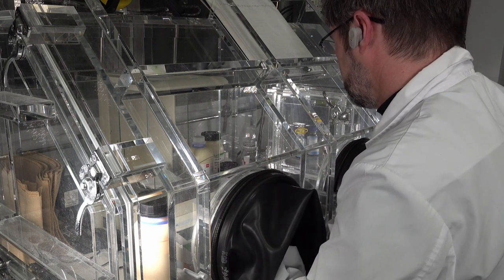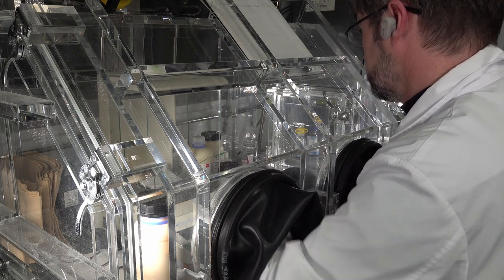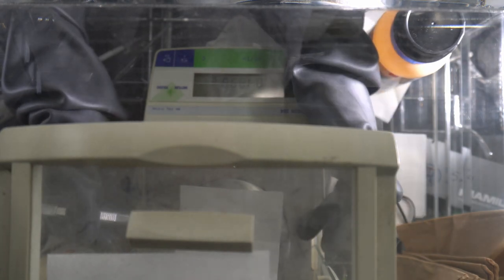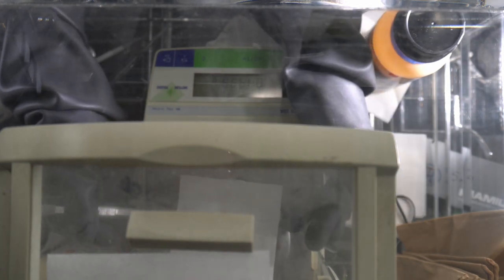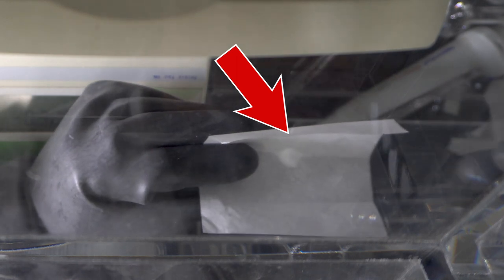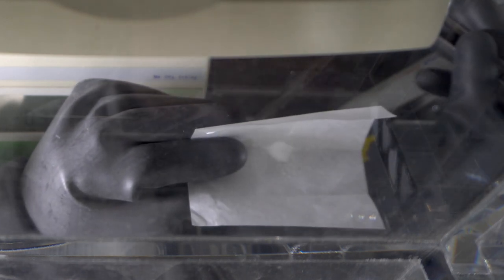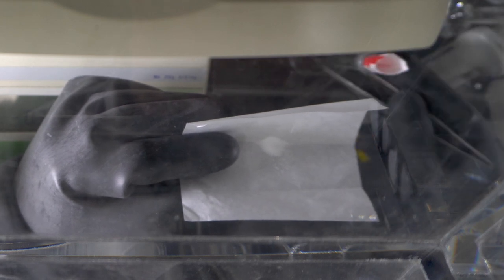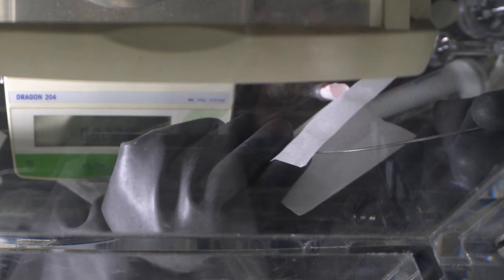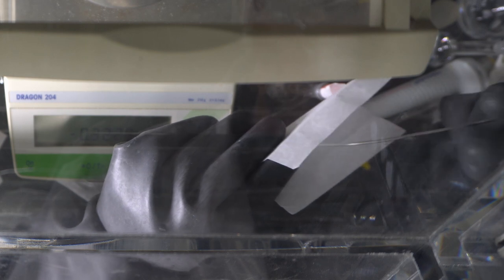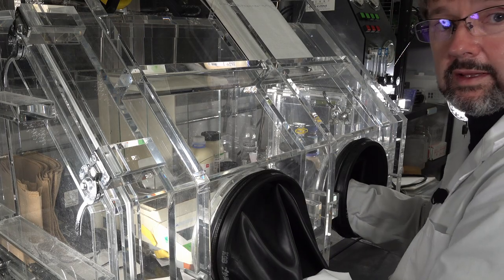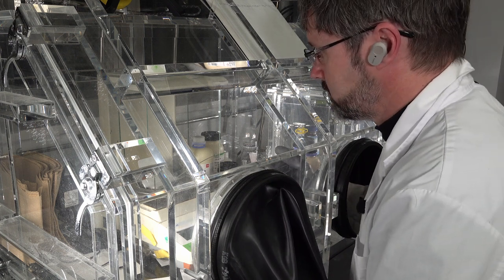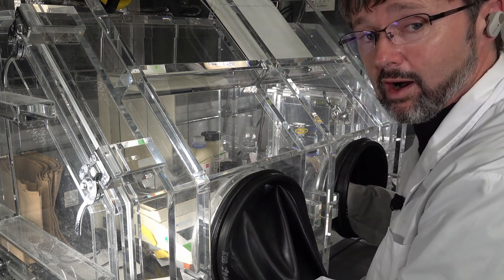So try and get it out of the weighing scales without dropping any of it. Fold it up into the V-shape. Now move the flask over.